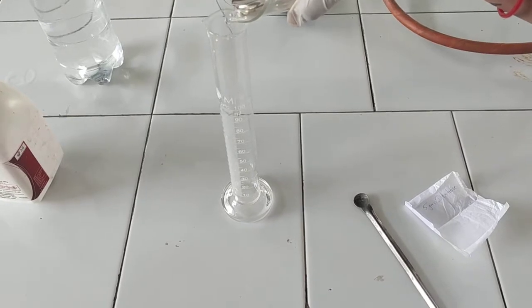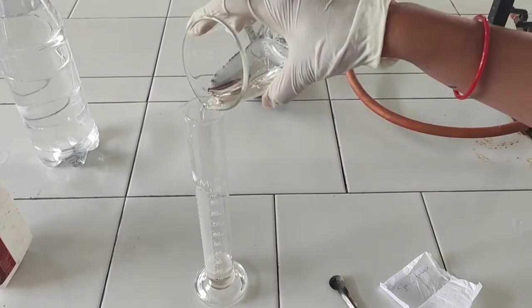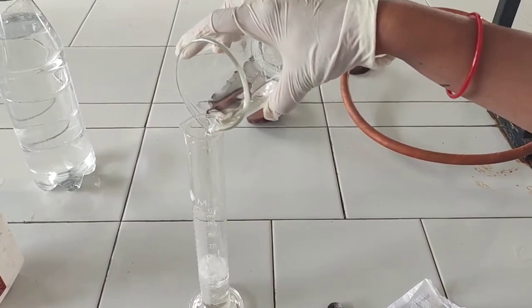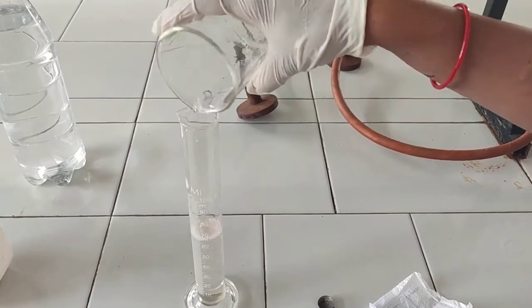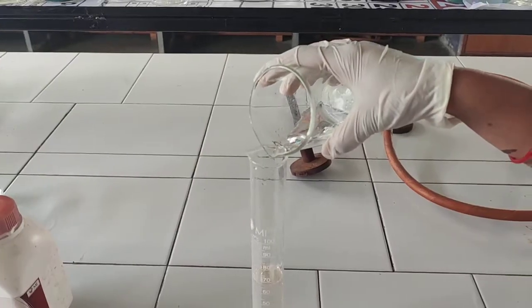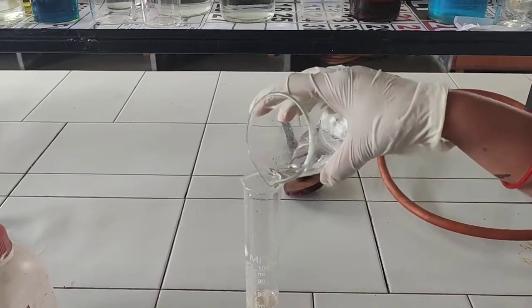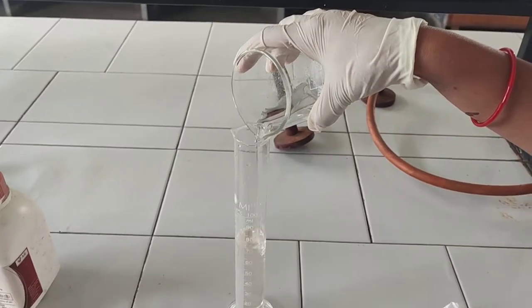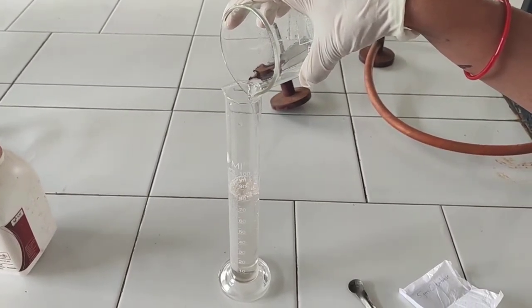We add one part, and when it dissolves, we transfer it to the measuring cylinder and make it up to 100 ml. We rinse the beaker with water and add the rinsings to the cylinder to make up the final volume to 100 ml.